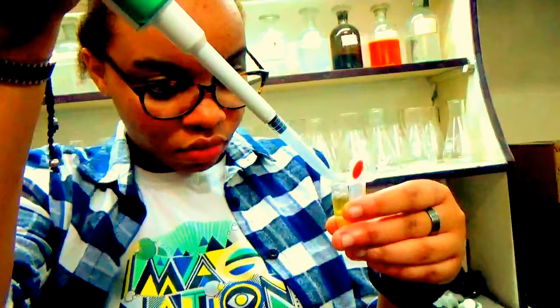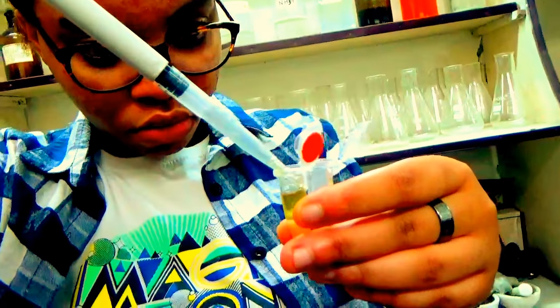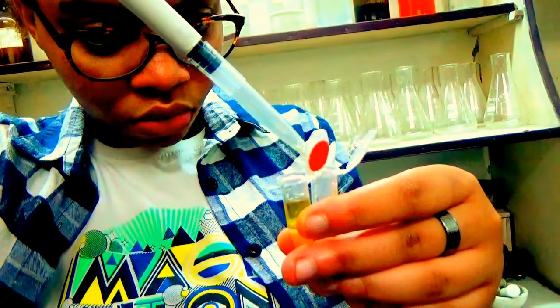You transfer it, okay? Take the pipettes and transfer it. Slowly, slowly. Drop by drop, okay?